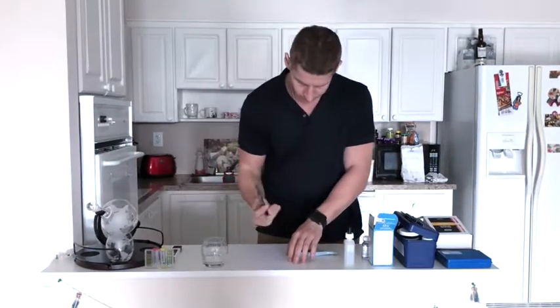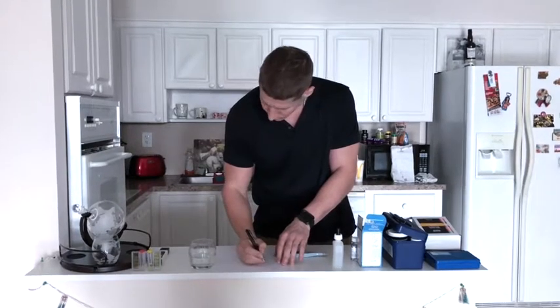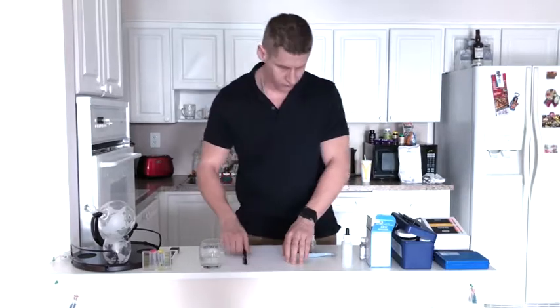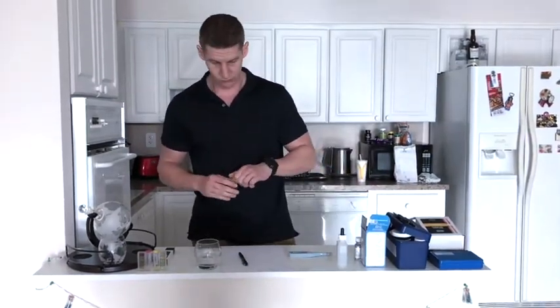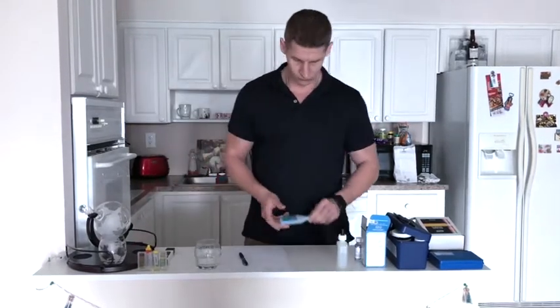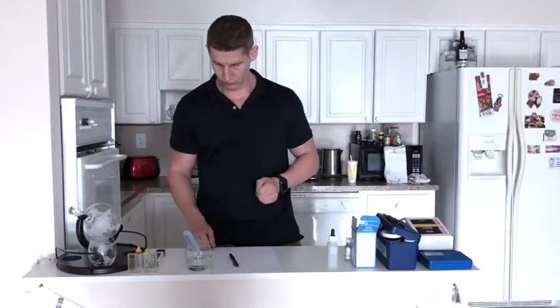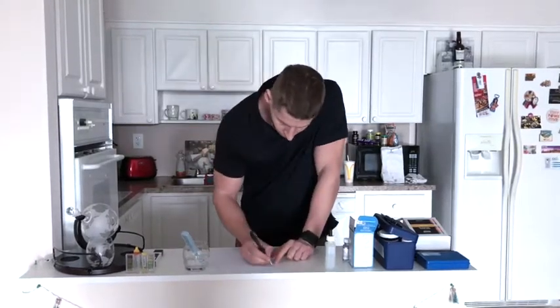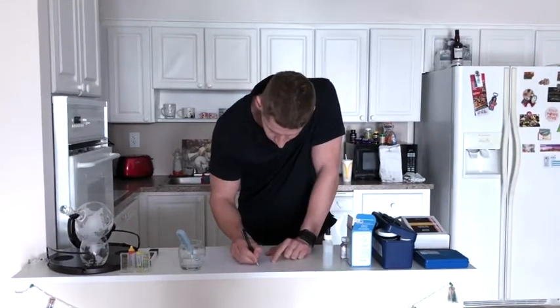Water hardness test. In scientific terms, water hardness is generally the amount of dissolved calcium and magnesium in the water. But in layman's terms, you may notice water hardness when your hands still feel slimy after washing with soap and water, or when your drinking glasses at home become less than crystal clear. The current number is 3 grains per gallon. Hard water can shorten the lifespan of your clothes by up to 40%. When it comes to bathing in it, it dries your skin and can damage your hair.